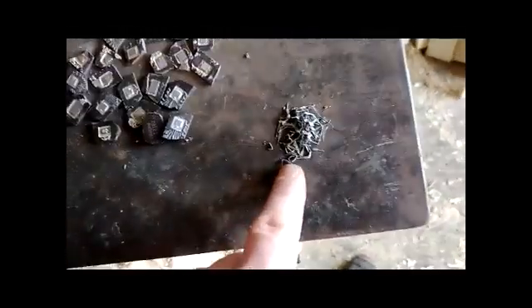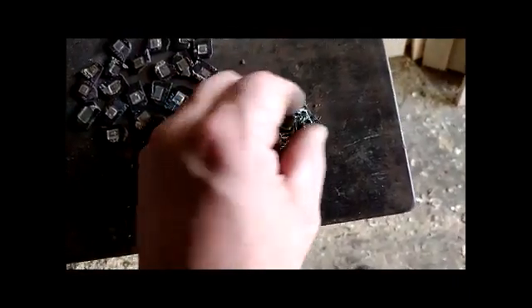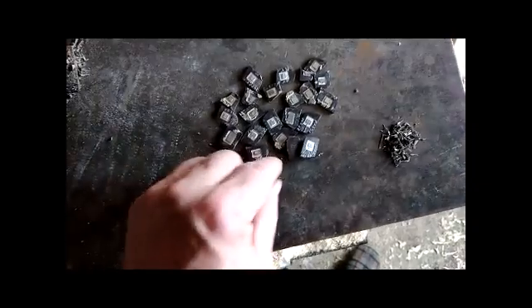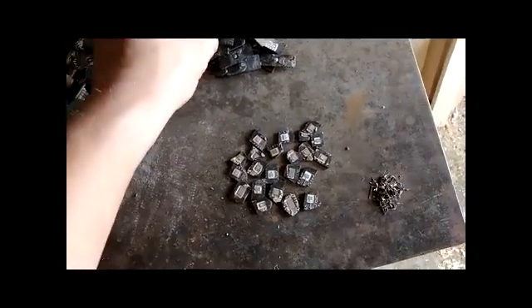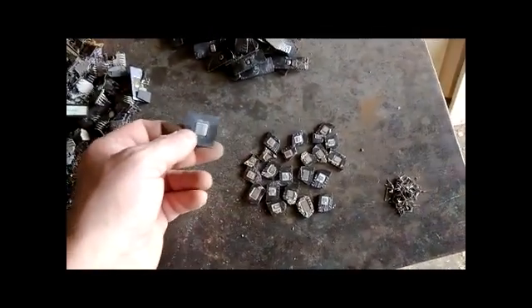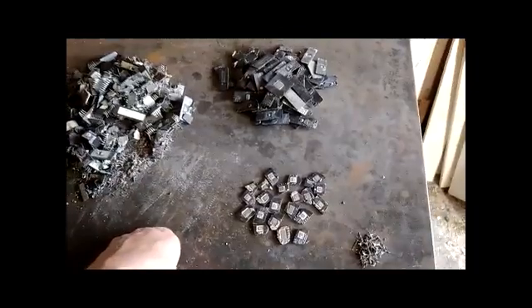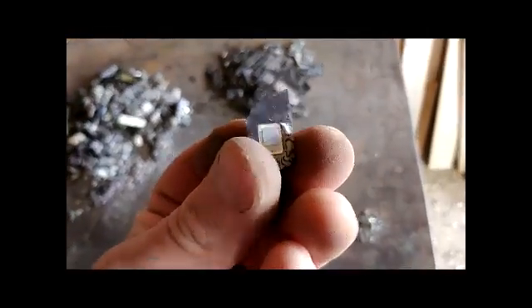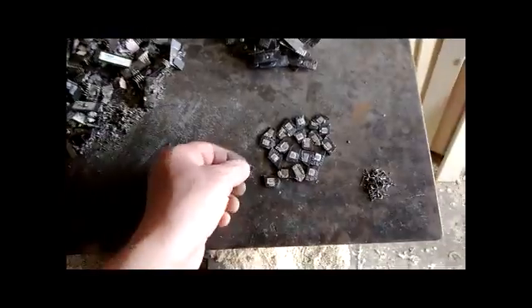I got a sample of the clean legs and I'm going to process this just to see if there's any silver on the leg, or maybe some other metal. But the brazed chips are our main material. If you look at what we have, maybe only about 20% have silver brazing and the rest — 80% — is just worthless with glue. Let's put that in the acid and see what kind of metal is in the middle.